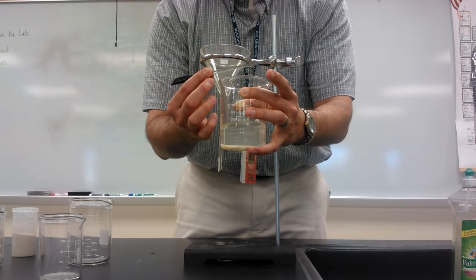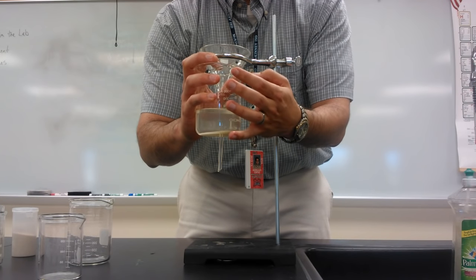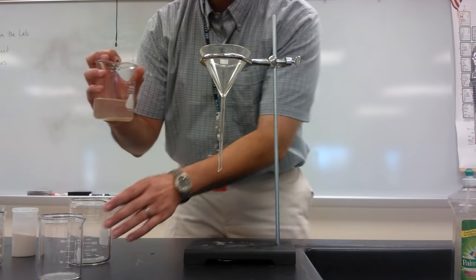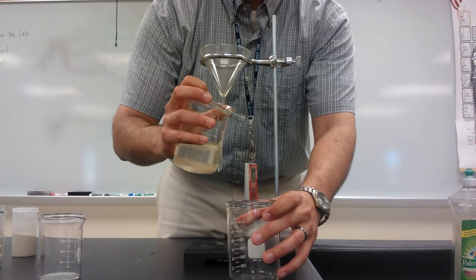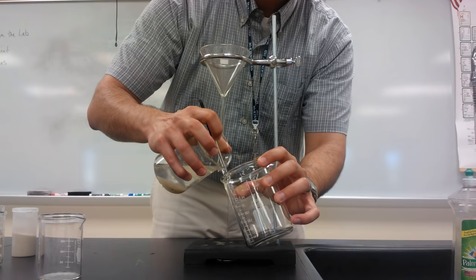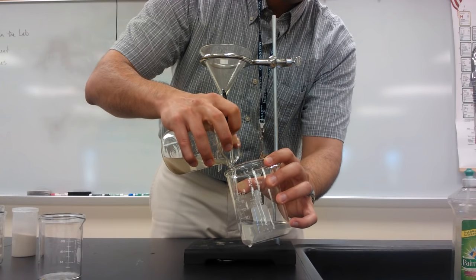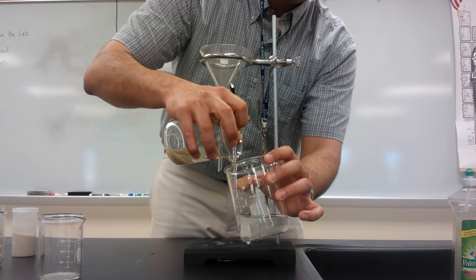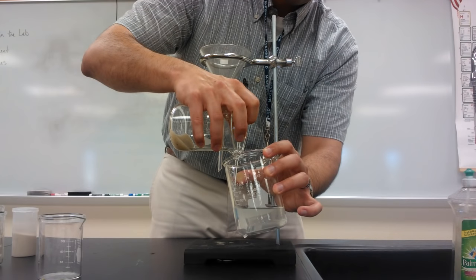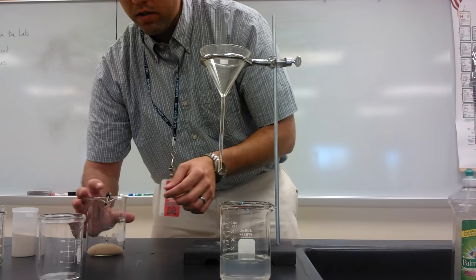Notice I'm going to take my chemical spatula and I'm going to put it over the top so that the glass part of this spatula is on the spout of the beaker. I'm going to hold it with my hand like this and I'm going to use it to pour into another beaker. What I'm trying to do is minimize splashing so that I don't lose so much of my solution. So I'm going to place this against the wall of the beaker and pour it carefully with just a slight tilt, so that it pours into the beaker — and notice there is no splashing. I'm pouring slowly so that the sand stays behind; at least the large particles of sand stay behind. And this is decanting. Notice I left most of the sand behind and I have mostly water over here.